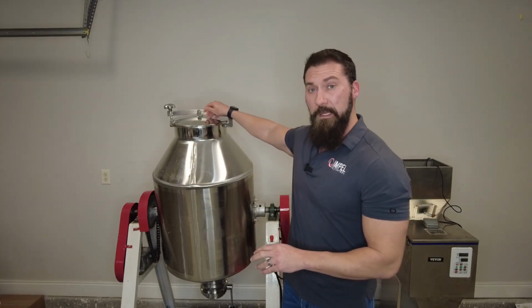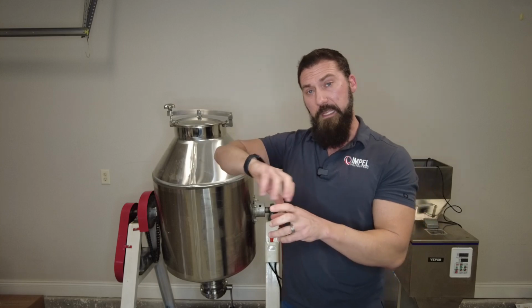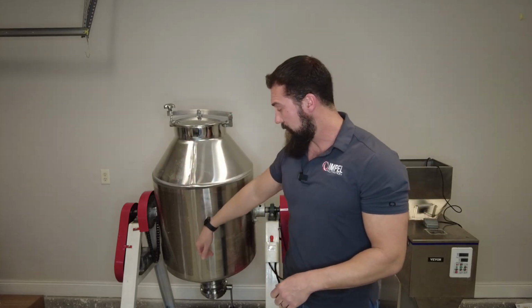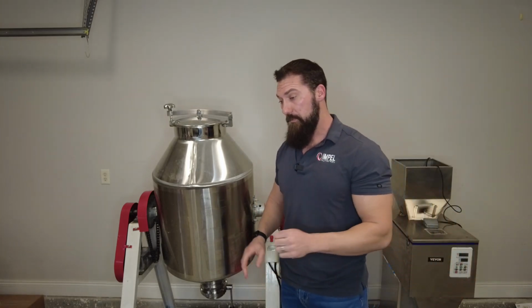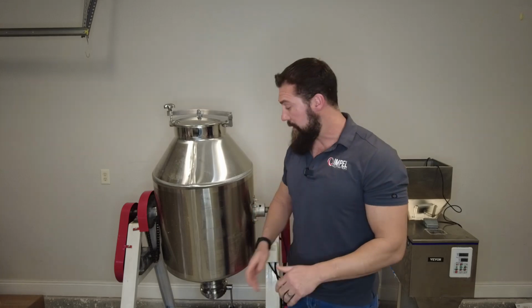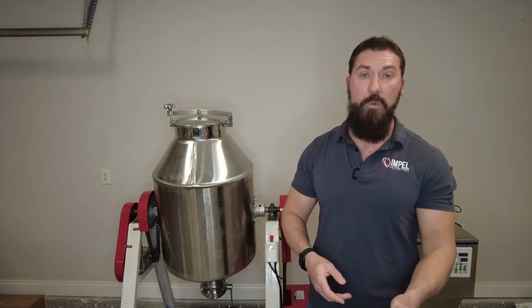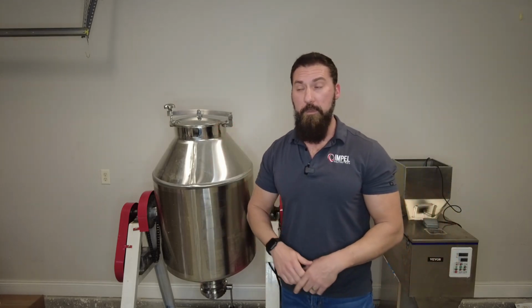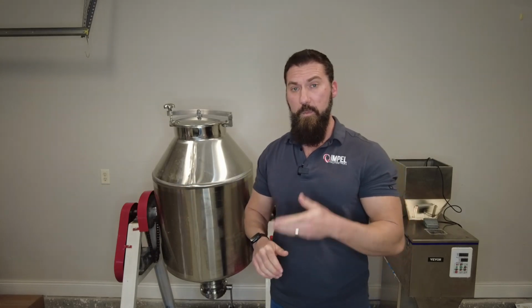We could open the top and you could put what's called a thief down in there. And so this is a probe that goes down, takes a little bit of a scoop. Generally, you would try to put the thief as close to the middle as possible. But also, if you're really trying to do this properly, you would have one that would be long enough to take 3 samples, one from the top, one from the middle, and one from the bottom, all simultaneously. Keep those samples separated and then we could put them into processing to understand what trace ingredient that we're going to be using as our benchmark to ensure that the mix is done properly.